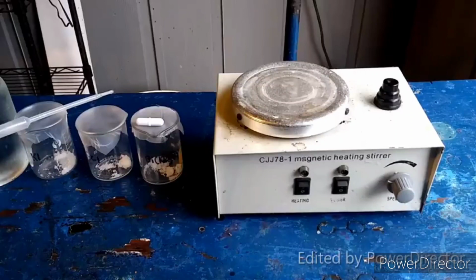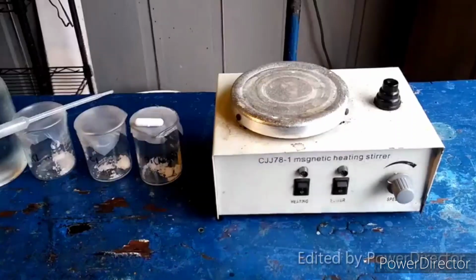As for the compound that we're going to make, it is a nice, vibrant, orangish red. If you want to see an example of it, there it is, because I kind of messed up. I did this once before because I wanted to dry it and see how it would behave after it dried, and I dumped it out.